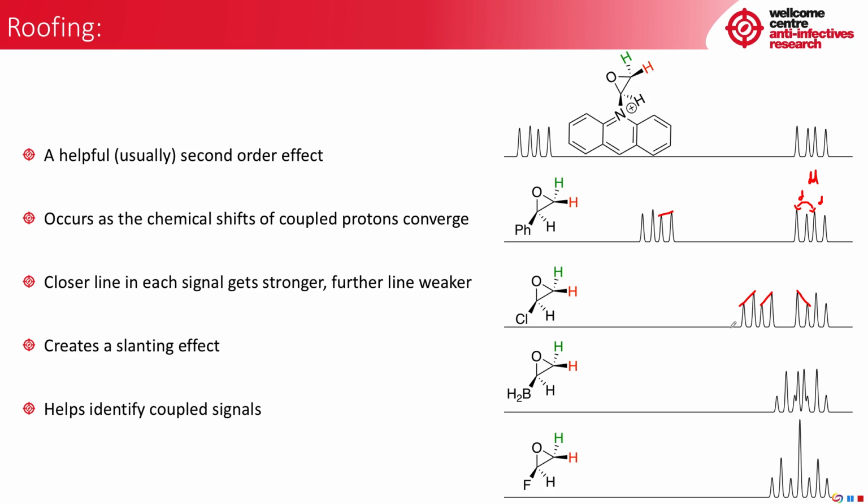A bit further still, and we go to a borane system. In this case, we're starting to see other second order effects. The shape of the signal is being distorted somewhat by the second order effect. But even so, you can still see the slant, although I would suggest maybe not measuring the J in this case. And finally, we have a special non-coupling fluorine, just for simulation purposes. And in this case, you can see there's a very significant slant, and in fact the signals are overlapping and starting to produce something a bit different.